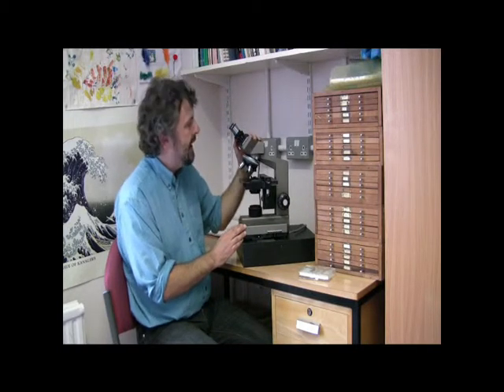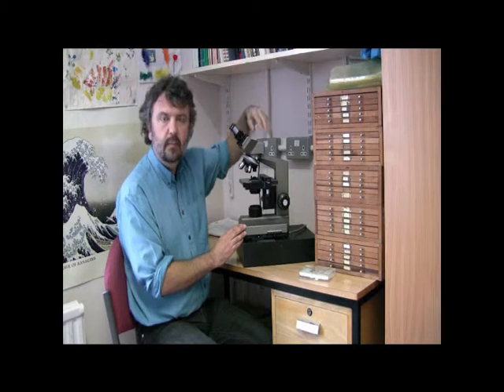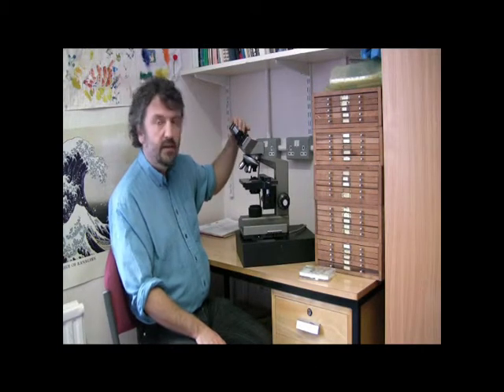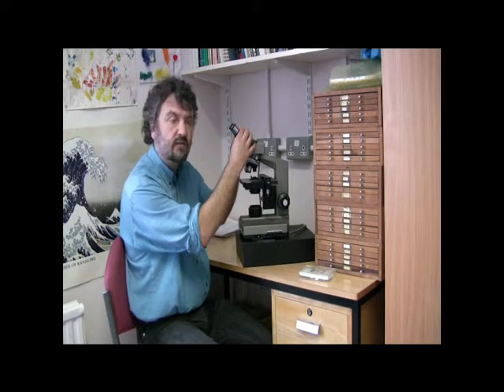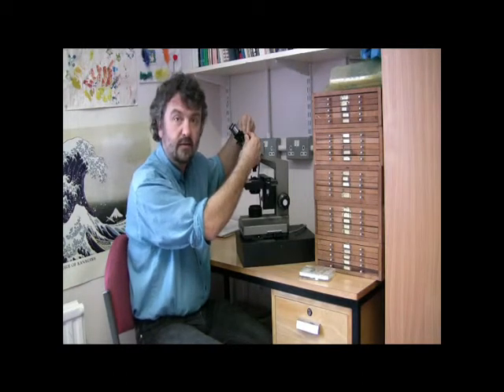At the top here we have the microscope head. On some models you can have an extra bit here which enables you to attach a camera — a video camera which can feed into a computer, enabling you to take photographs of what you're looking at very quickly as a record of what you've seen. The head itself has the eyepieces and optics, and quite often you can focus those individually using these dials. You can also adjust the width depending on how far your eyes are apart from one another. So that's the microscope head.